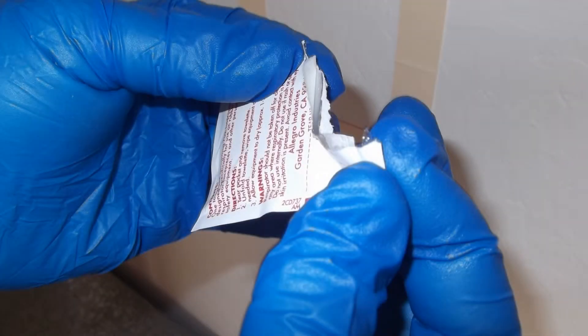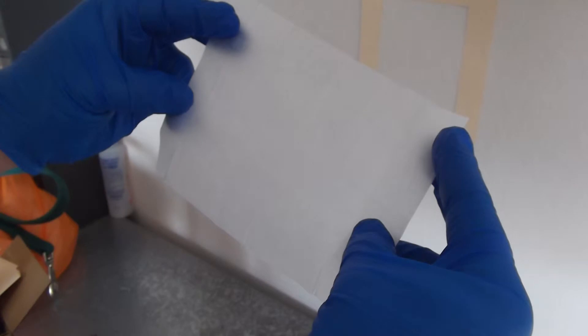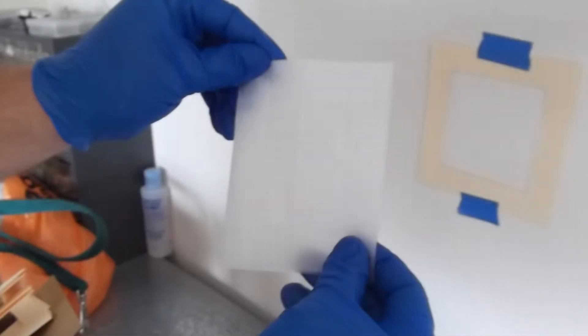With freshly gloved hands, take one pre-treated wipe from the package. Fold the wipe in half and then fold in half again.